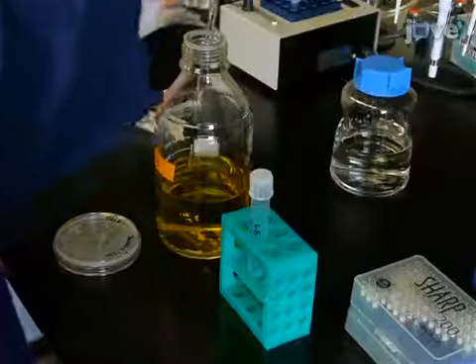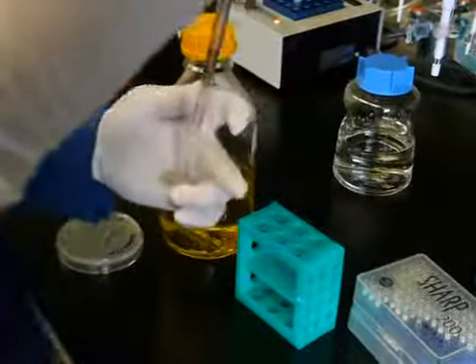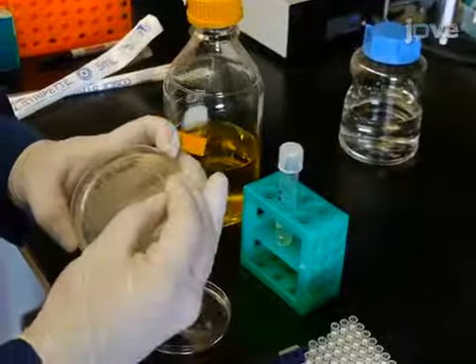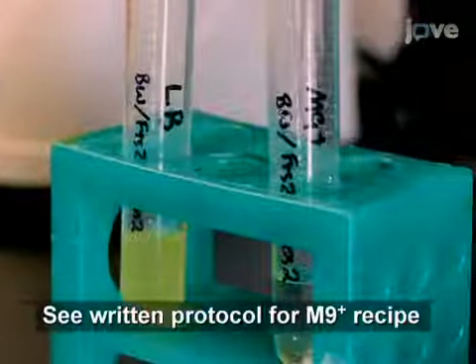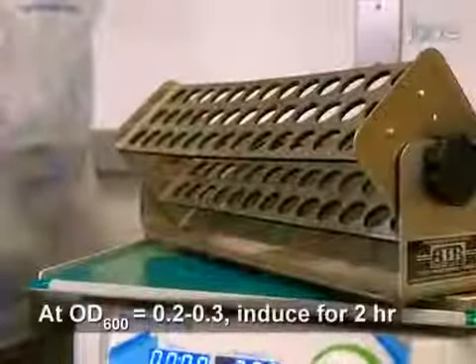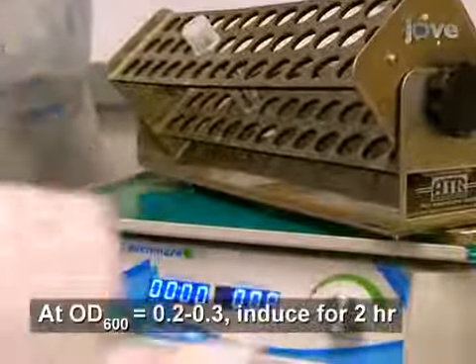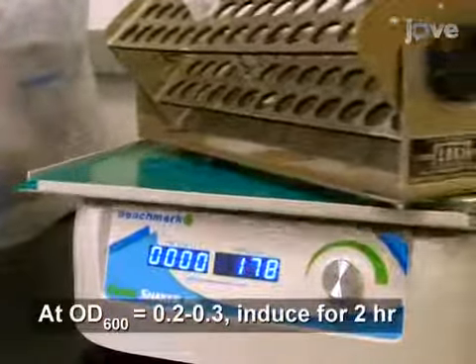To begin, inoculate LB media with a single colony of the strain of interest containing a fluorescently tagged protein prepared as described in the written protocol accompanying this video. Grow overnight in a shaker at 37 degrees Celsius. The following day, dilute the culture 1 to 1000 into M9+ minimal media. Grow to mid-log phase in the presence of appropriate antibiotic at room temperature, and then induce the culture to produce protein with 20 micromolar IPTG for 2 hours.